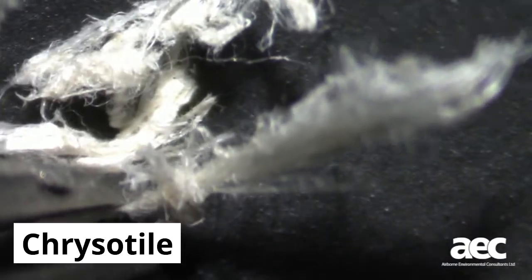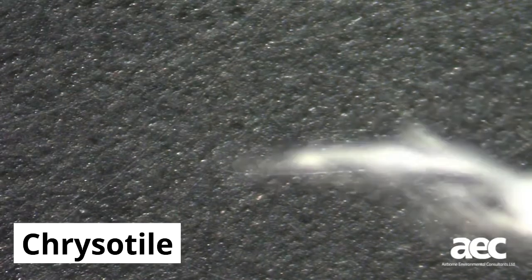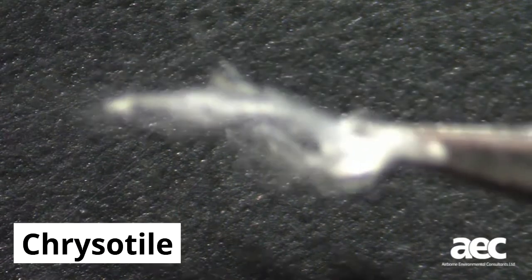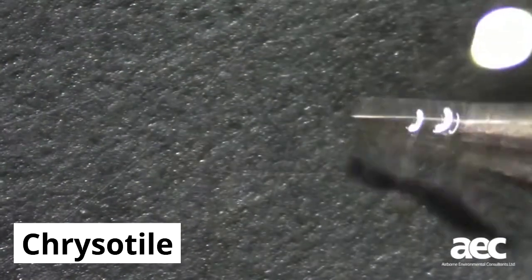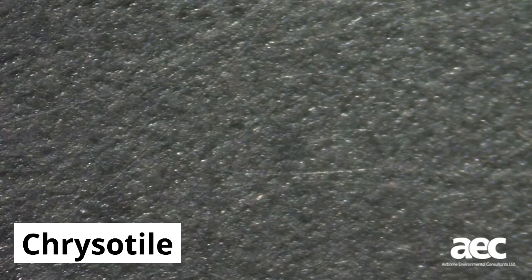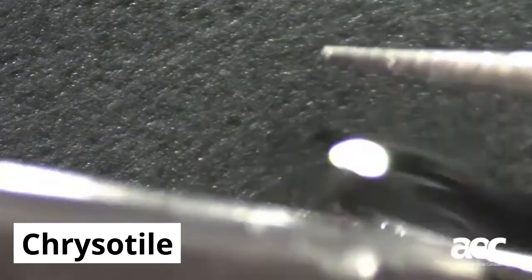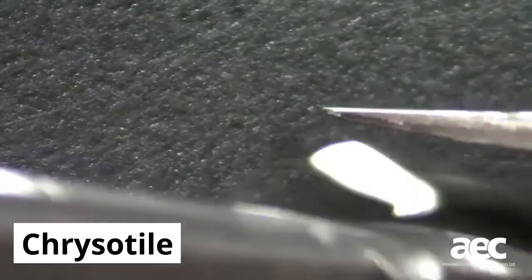Suspect fibres are then taken and mounted onto a microscope slide in a liquid which shares similar optical properties to that of chrysotile, in this case a liquid with a refractive index of 1.550. The slide is placed under the polarised light microscope and the optical properties assessed.